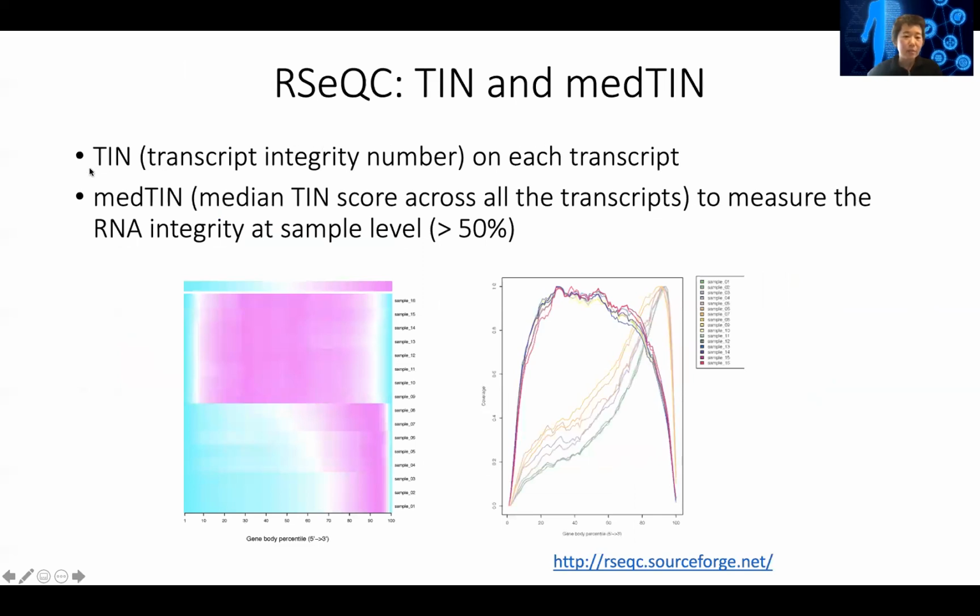Another very important QC measure, especially for archival tissues, is the TIN score, or the transcript integrity number, on each transcript. This is calculated on every gene, and at the end there is a median TIN score, which is looking at the median TIN across all the transcripts. So here you can look at individual samples' median TIN score, which measures the RNA integrity at the sample level. You want this usually to be about 50%. This just gives you an idea.